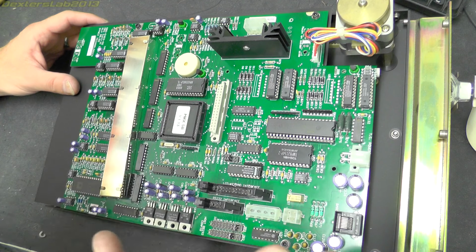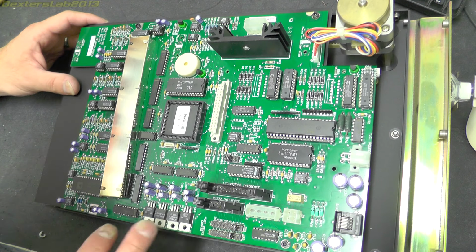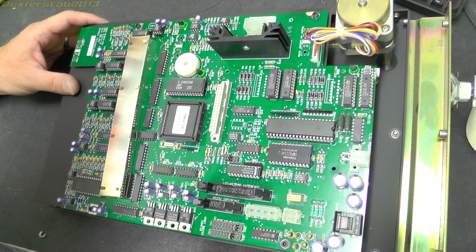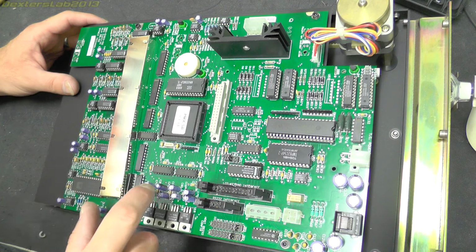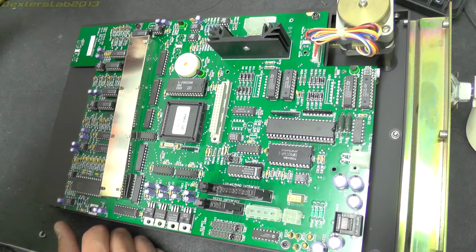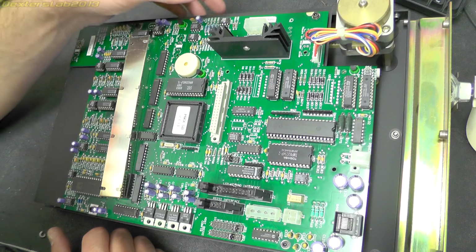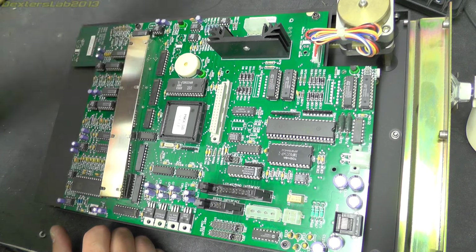So if we work a bit further down, we've got the connectors that carried the power, the connections over to the keypad and LCD interface, the RS232 interface. We've got a number of jumper settings there for TXD and RXD, host RS232 config, so they're probably baud rates or something. Looks like we've got some voltage regulation just here. In the centre here we have another unused connector. This is called hot plate option, so maybe some kind of heater element that could be provided. We've got a beeper, some analog devices chips just there, and large heatsink, so that's possibly something to do with the motor drive. We've got a couple of large devices here. We'll have a look at those in a moment.